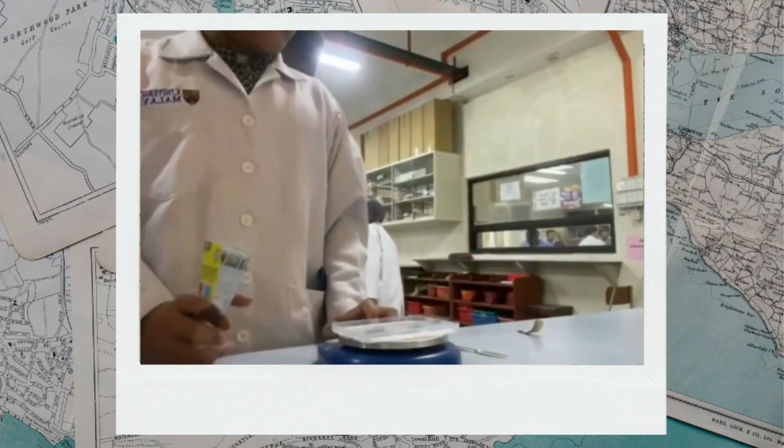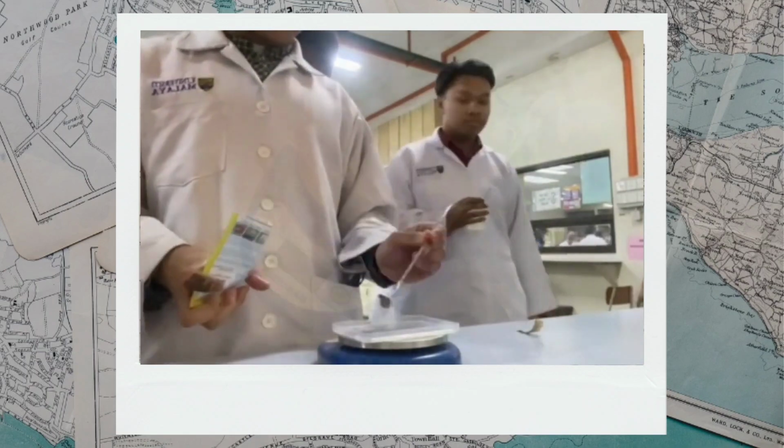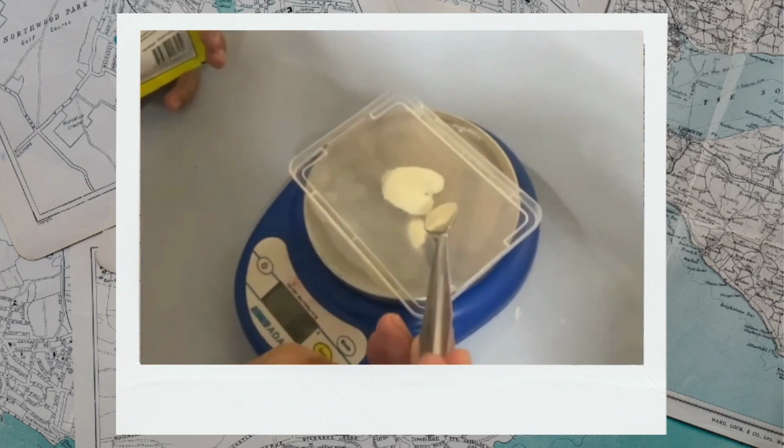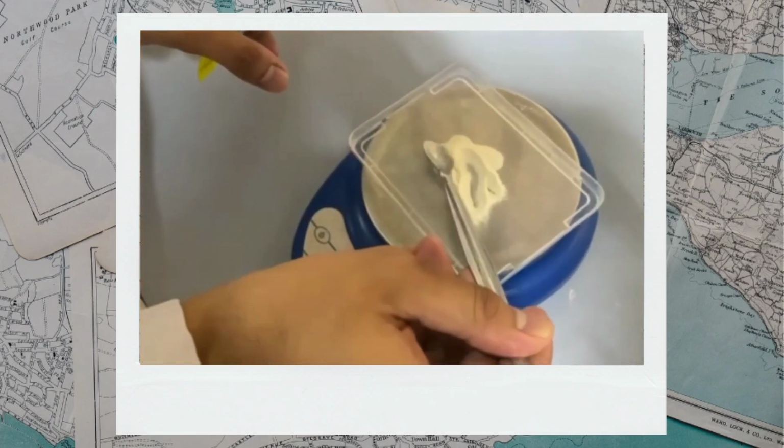Next, make 1% gel solution by adding 0.5 gram of agar-agar powder to 50 milliliters of sodium bicarbonate buffer. You will need 40 to 50 milliliters of gel solution per setup.